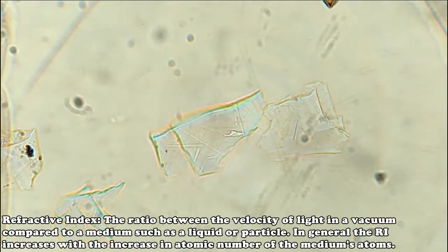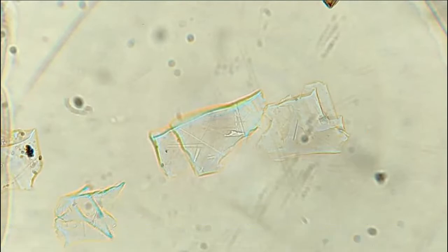Now let's move on to the refractive index. In this particular example, the quartz is in 1.550 refractive index oil. Even though I'm using a standard lens, I'm not in one of the dispersion staining lenses. When we close down the substage iris, you can begin to see a little bit of blue color showing up.